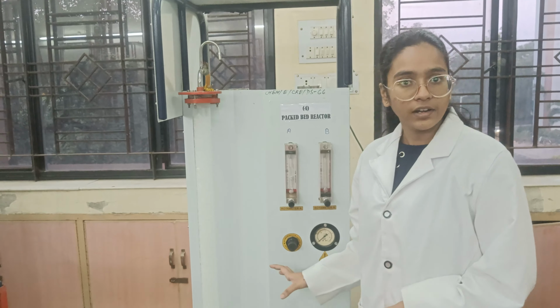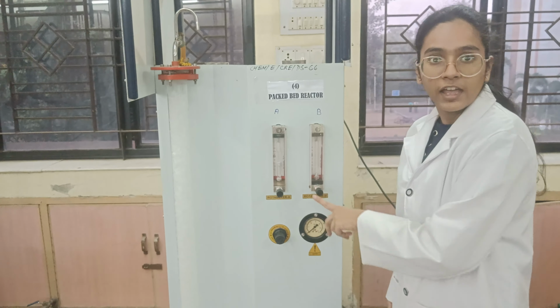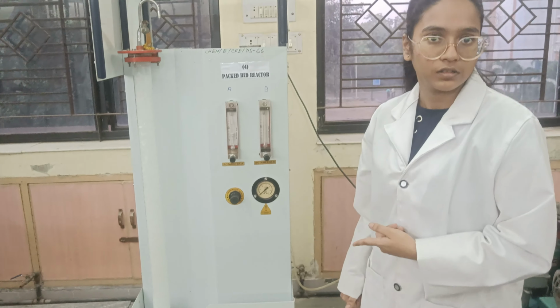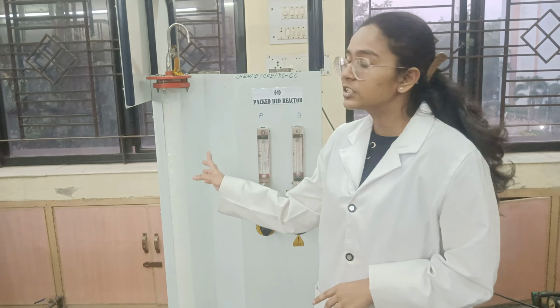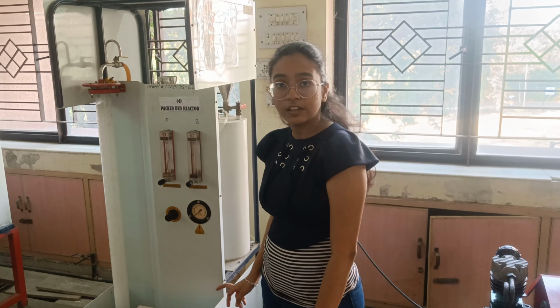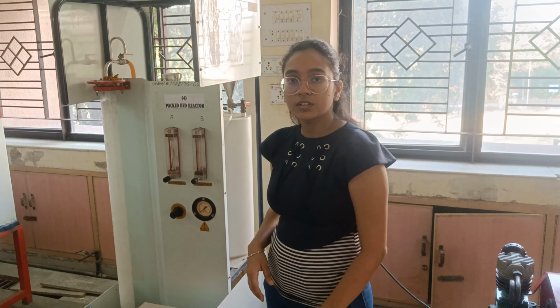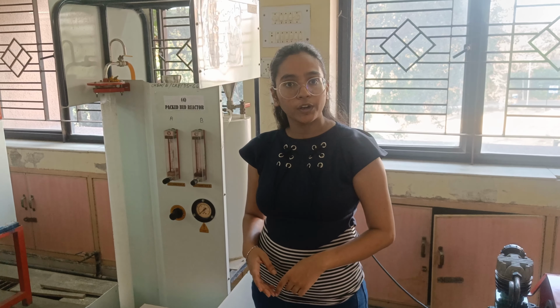Once this is drained, we will again set our flow rate to 7.5 lph and repeat the procedure. For this, we will wait for 6 minutes. We have demonstrated the procedure for the flow rate of 5 lph. After that, we will repeat the procedure for the flow rates of 7.5, 10, 12.5 and 15.